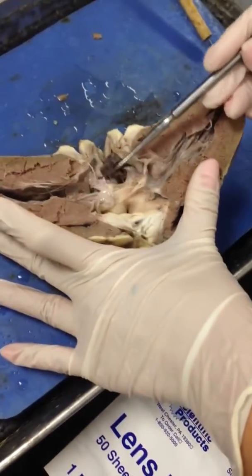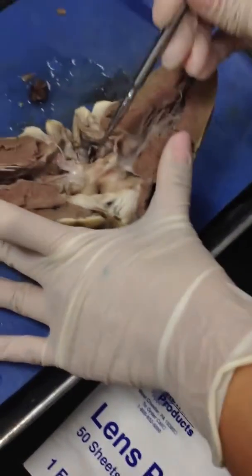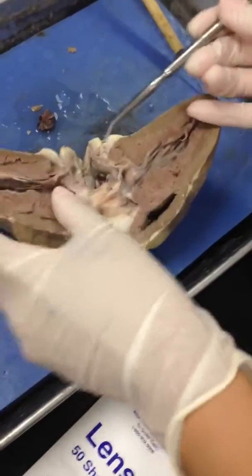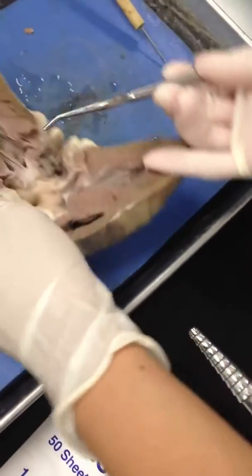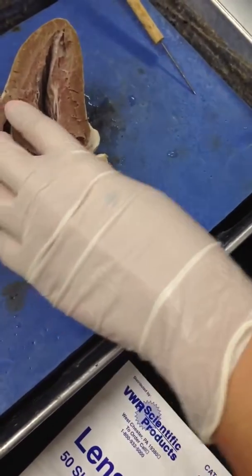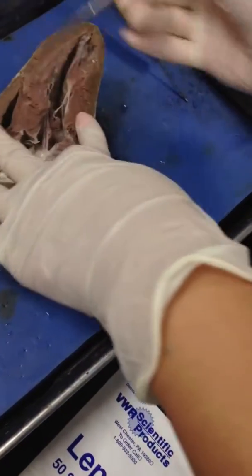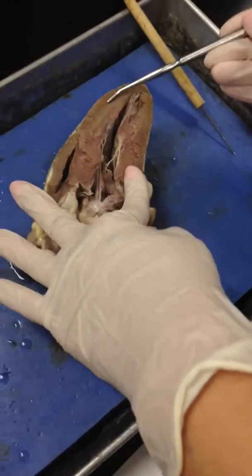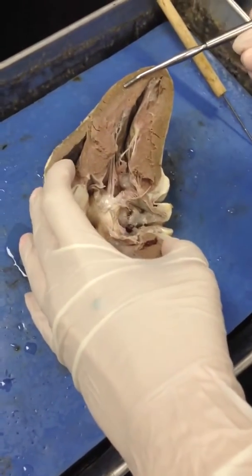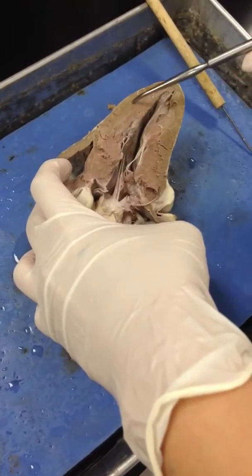And this is just blood. All right. And then we have this septum — like a nasal septum separates the two nostrils, this interventricular septum will separate what? Left and right ventricles. Left and right ventricles. So, interventricular septum.